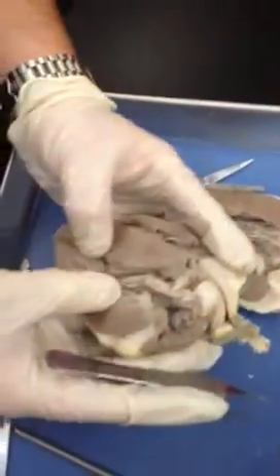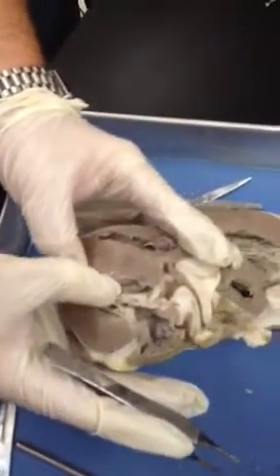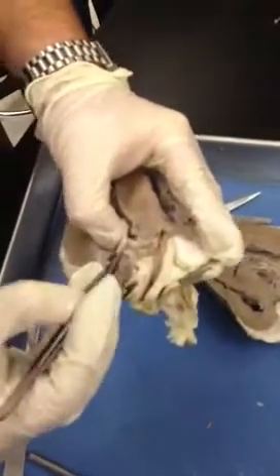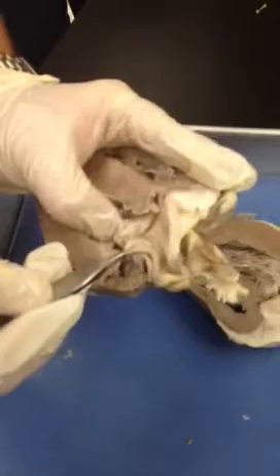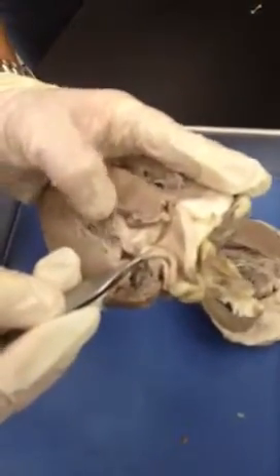As we leave going out the left side of the heart — the thick side, the left ventricle — we're going to go out through the middle, which is the aorta, and we can see over here this aortic semilunar valve. We have several aortic semilunar valves. The aorta, being an artery, is much thicker than the veins, which we saw in the superior and the inferior vena cavae.